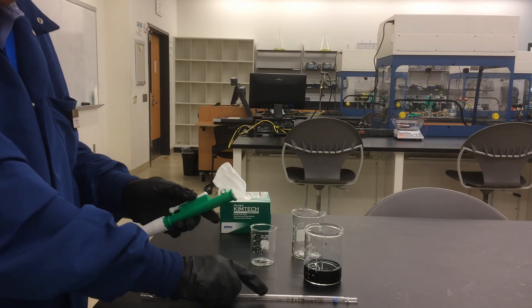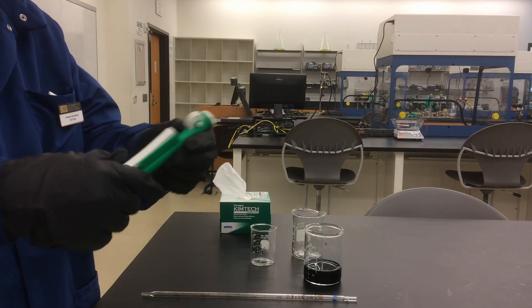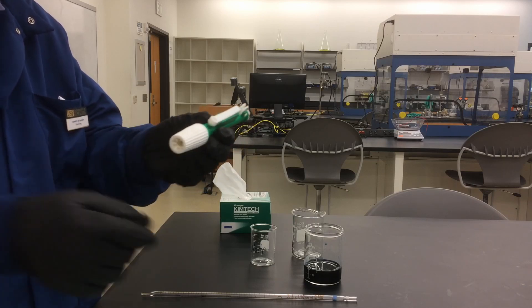First of all, let me show you how to use this syringe type pump. It has a hole, also called a gasket, where you put the pipette in.